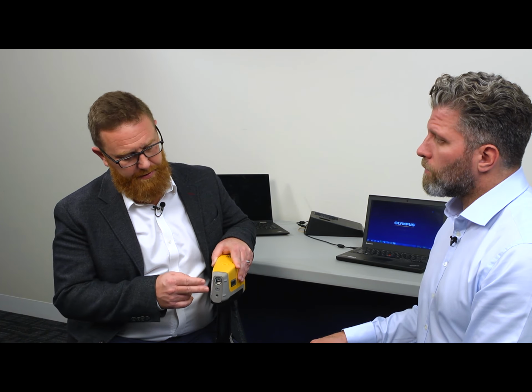It is, but the concept we need to get across before we start talking about sample containers is that whatever is between the detector and the tube inside here and the sample will affect the performance of the instrument and attenuate X-rays. So what you're saying, the thickness and the density of that window is very important to your XRF analysis. It is. It directly affects the performance and how low you can measure generally.